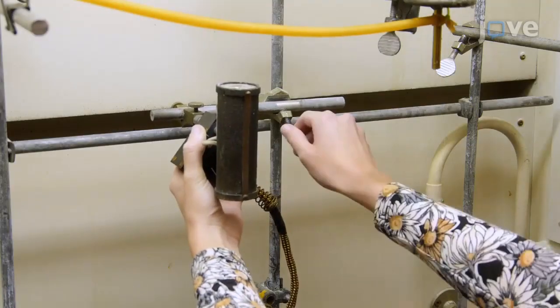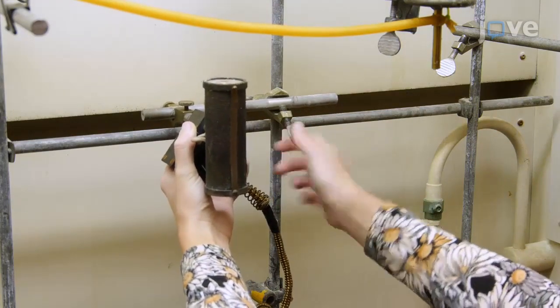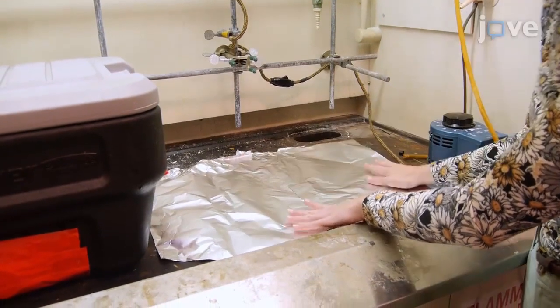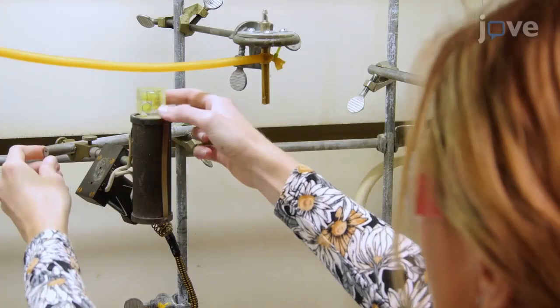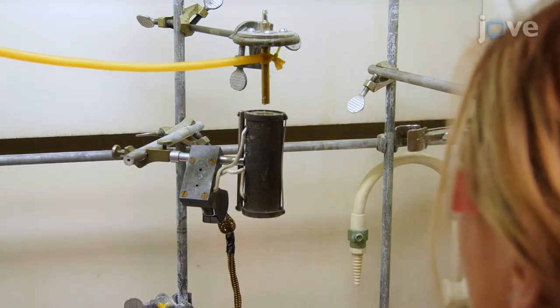Then, fix a cylindrical ceramic tube furnace vertically in a fume hood 2 feet above the floor of the hood. Lay aluminum foil under the furnace to catch excess PDMS during extrusion. Mount the extrusion adapter above the tube furnace with the aperture centered on the furnace opening. Ensure that the furnace is not at an angle so that extruded filaments will not contact the furnace.